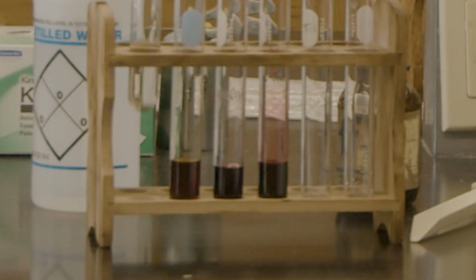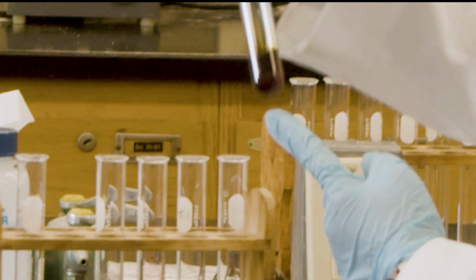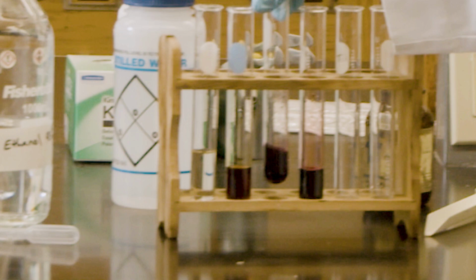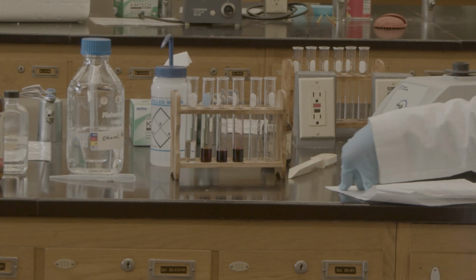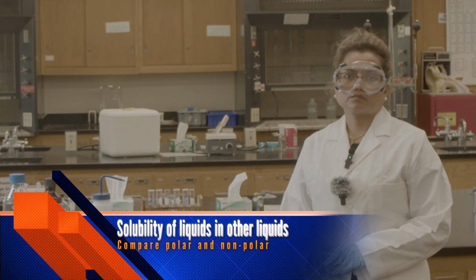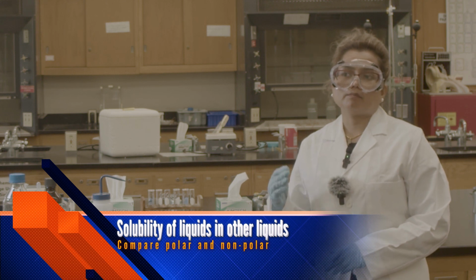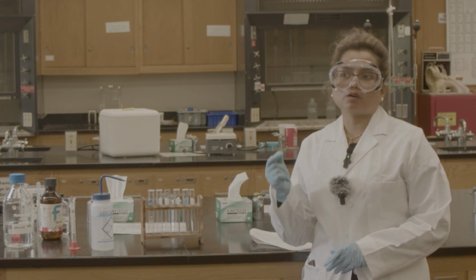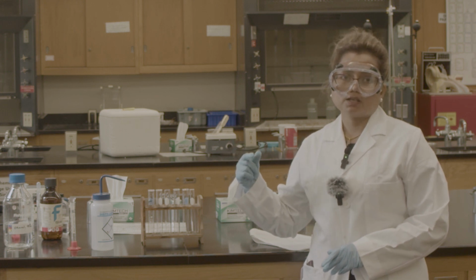So water still has crystal. It's partially dissolved. I can see there is still iodine at the bottom. Okay, with the chloroform it dissolved, and also in the toluene it dissolved. In group 3, what we did is iodine, which was a crystal and solid. So we tried to dissolve the solid non-polar in different types of solvents, the liquids.